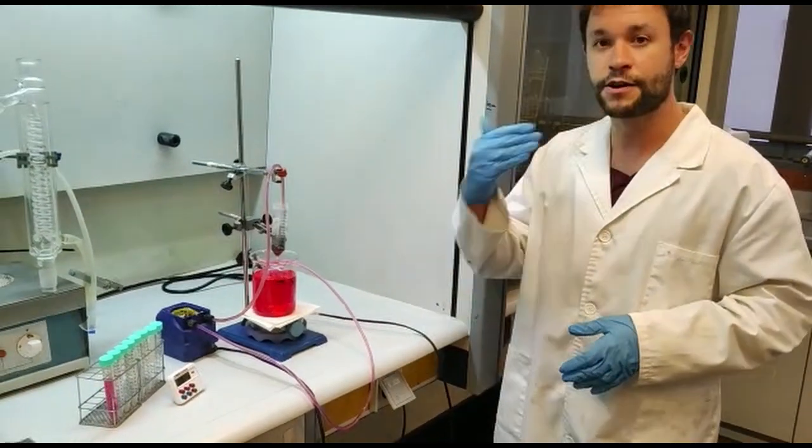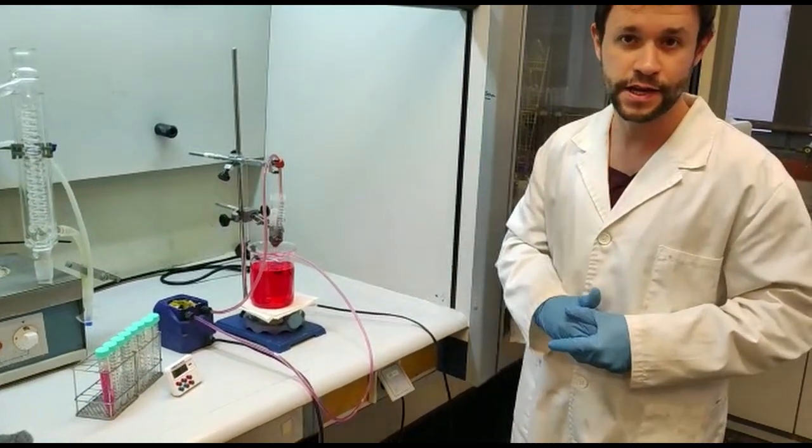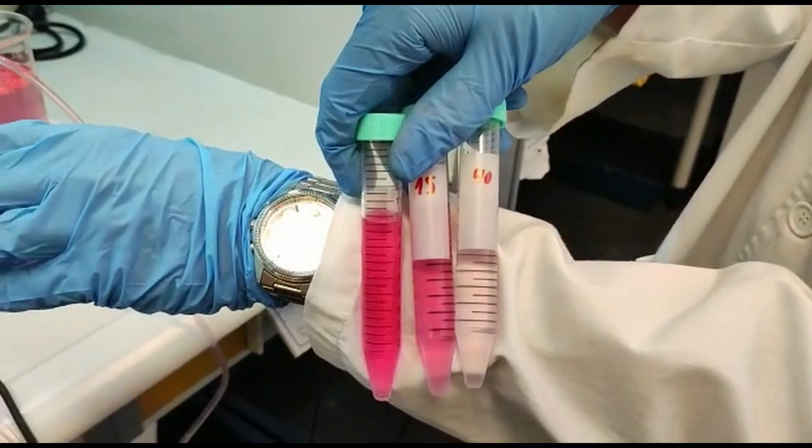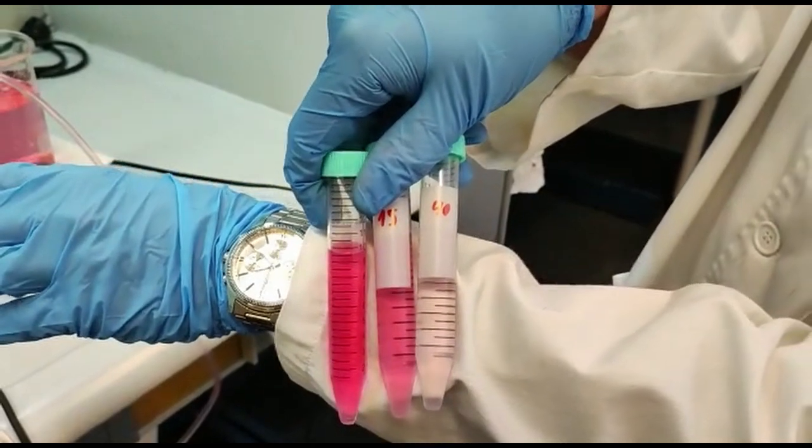We are going to observe the decoloration over time of the solution. You can easily see how fast the reaction is.